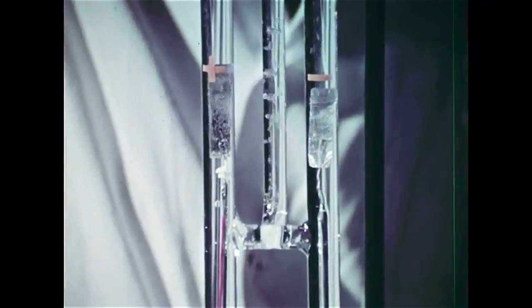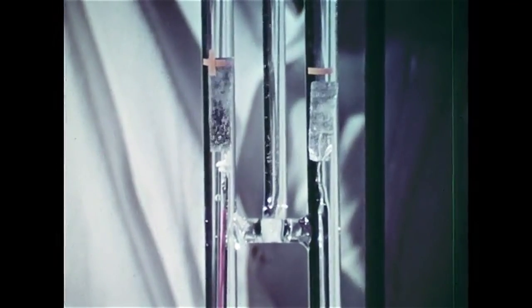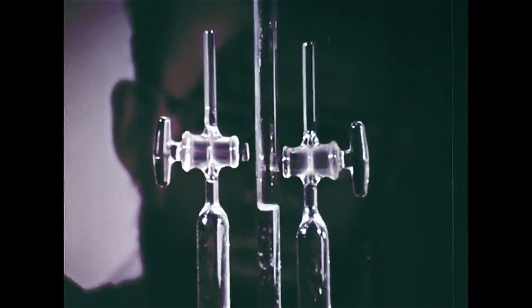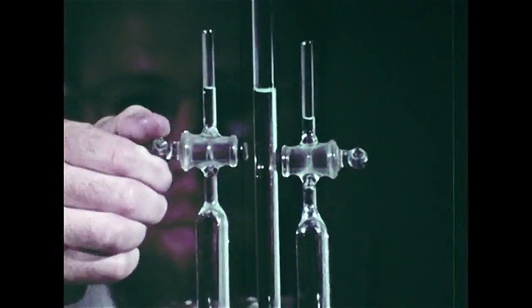As before, a gas is starting to be evolved at each of the poles. The stopcocks are closed to keep the gas from escaping, and we have only to wait until enough collects for testing.